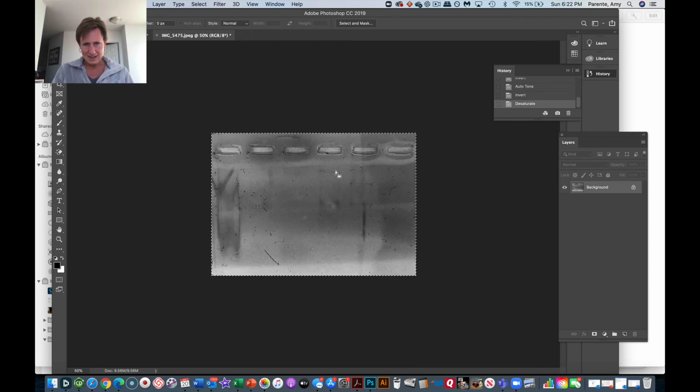So what I can see now is, and let's see if we auto level that a little bit better. What I like is I can see down here a little bit better. I've got this degraded RNA. Here again is my eluted plasmid, and then this was the double digest that we had. So one of the things that's important for us to do, and it's unfortunate we don't have a marker that really showed up well on this gel, is we wanted to be able to see when we had some insert that got dropped out, what was the size of the insert.